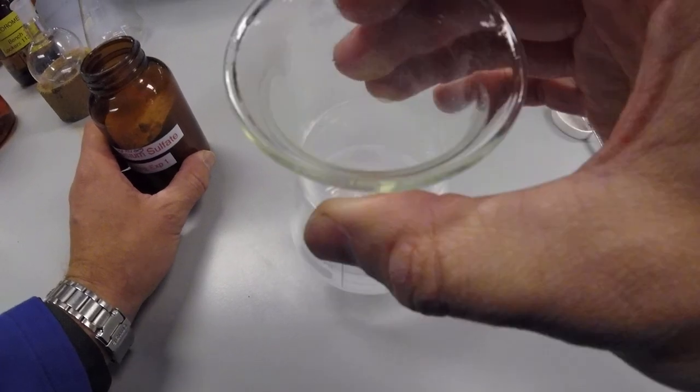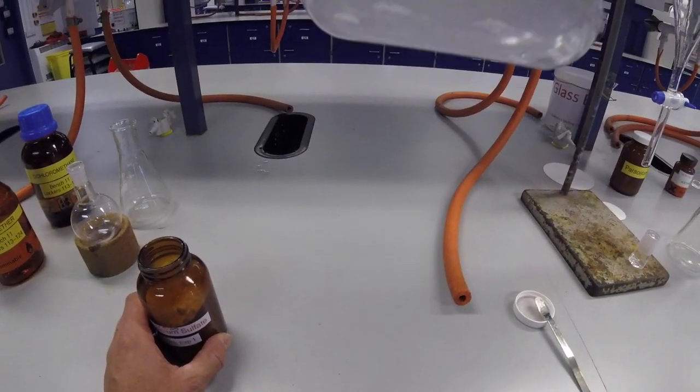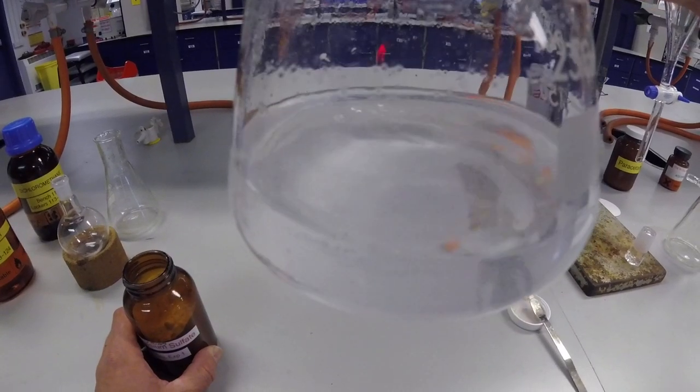You might be able to see that it all sticks to the bottom. And it looks, to all intents and purposes, very wet.